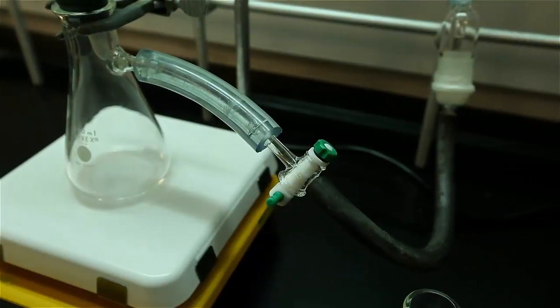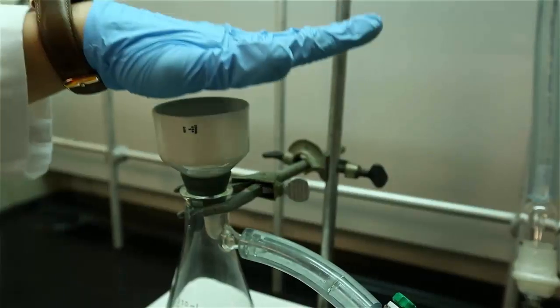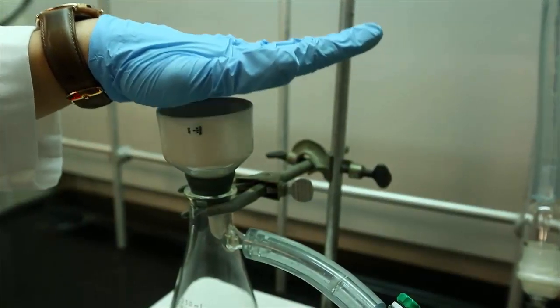Then, open the stopcock and check for vacuum with the funnel by cupping your hand over the funnel to feel air being drawn through.